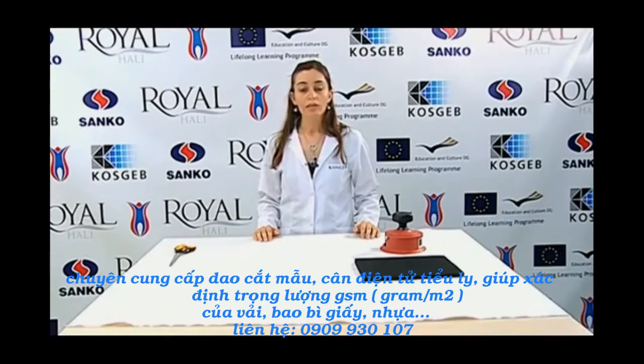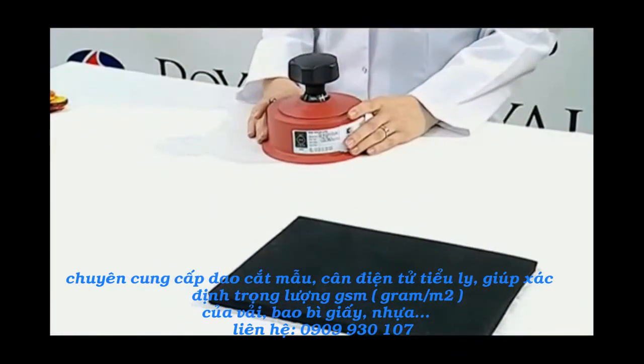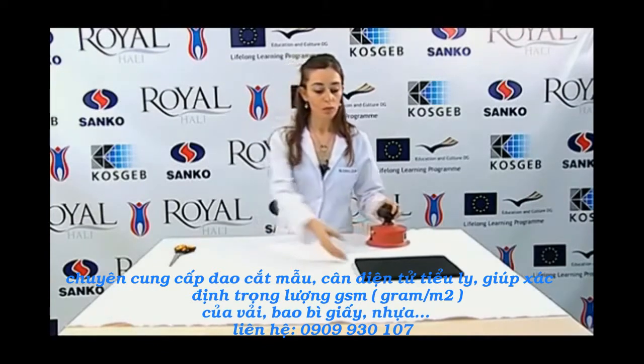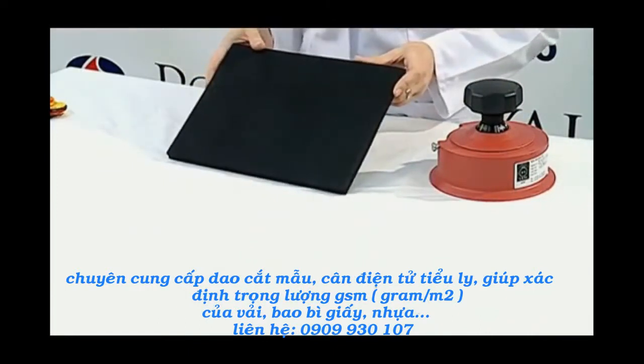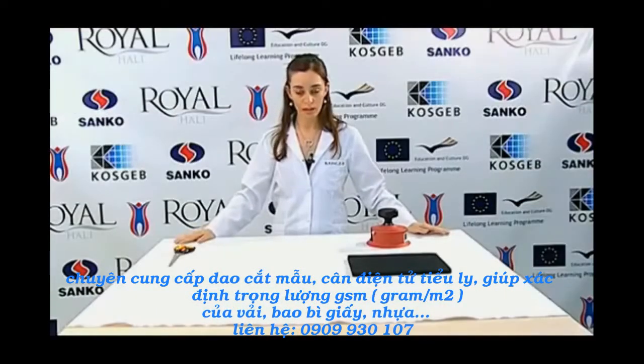The first device that is used in the test is the sample cutter template. This template can be cut as a 10 by 10 square centimeter piece, as well as an area of 100 square centimeter circle. Today we are going to use a circular area. Also, we are going to use a cork plate on which the cutter is placed when cutting the sample. Additionally, the fabric should be laid on a flat surface, and thus we need a table for this. Finally, we need a precision balance to weigh the items.